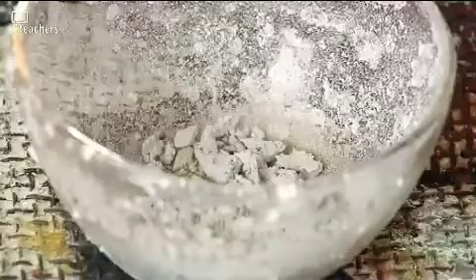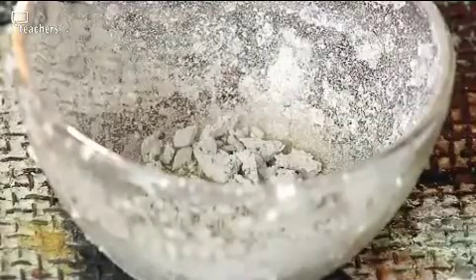The copper sulphate crystals have dehydrated to anhydrous copper sulphate. In a few cases, this can decompose further and produce corrosive sulphur trioxide and toxic sulphur dioxide, and the latter can affect any asthmatics in the classroom. Oh, really?